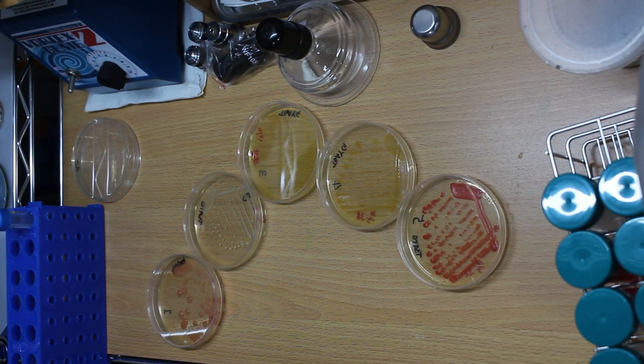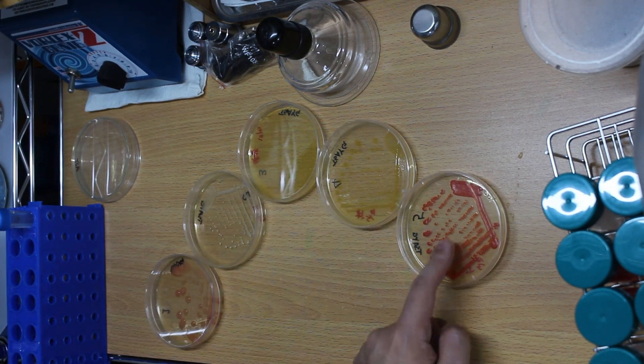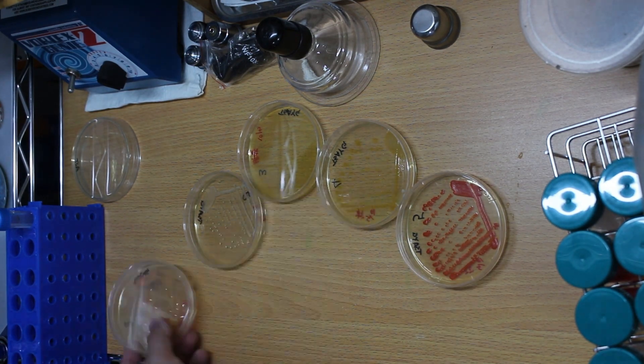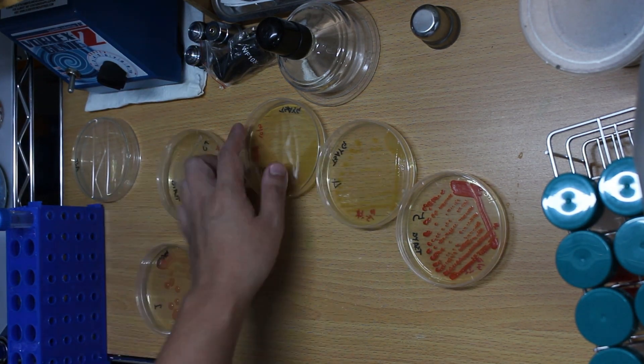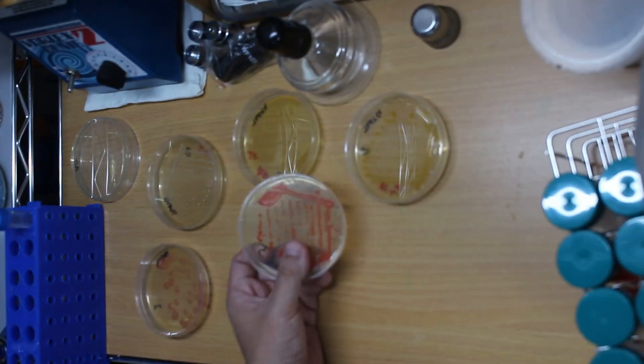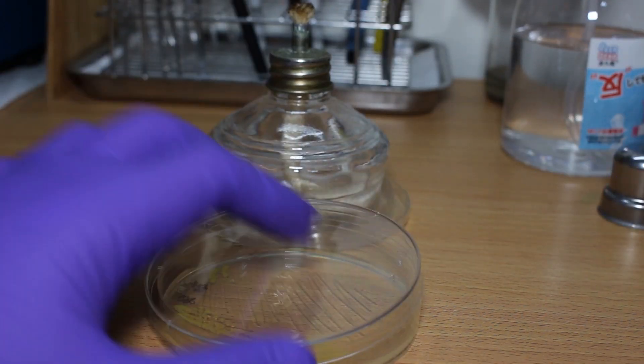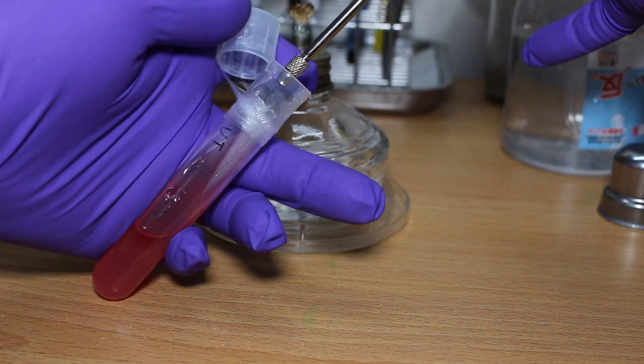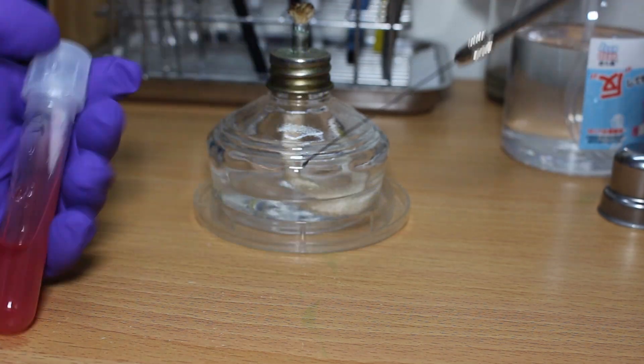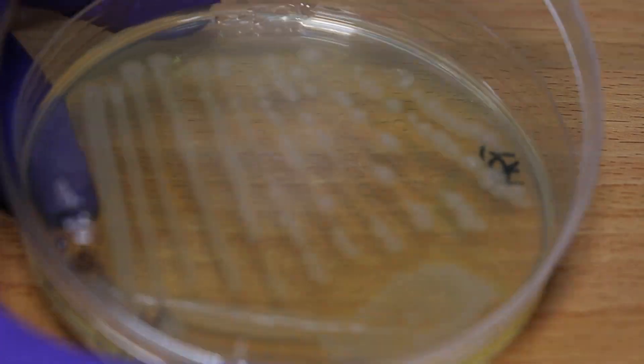I ended up isolating 5 bacteria as you see here, all of them look interesting and very different from each other. So now what? Well, I want to know what species of bacteria I got, at least what genus it is, so I plan to run some tests on those bacteria, some old-fashioned biochemical tests.